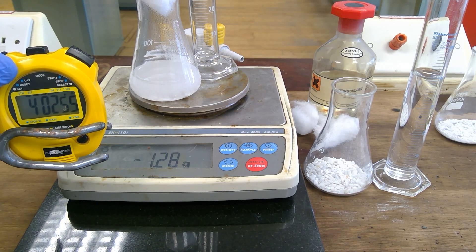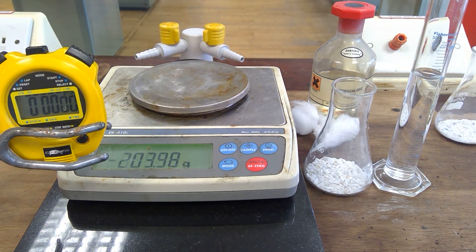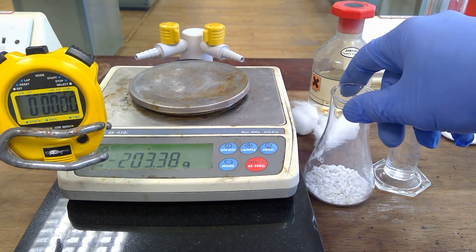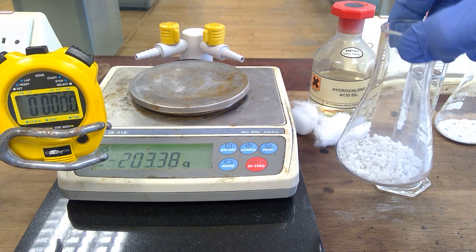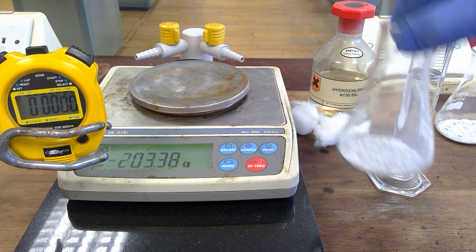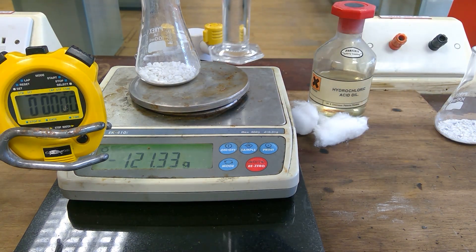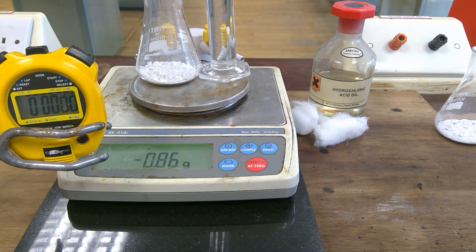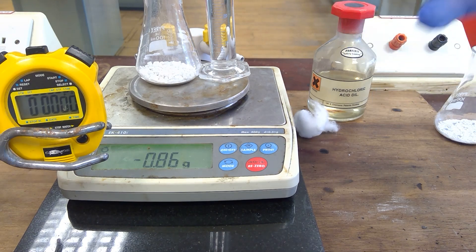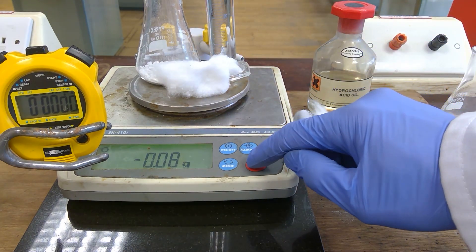We've stopped recording at this point. The next experiment is identical, except this time we're going to use marble chips which are a little smaller, so their surface area is bigger. However, it's still 20 grams, which will be placed on there, and again 40 cm cubed of the 2.0 mole per cubic decimetre hydrochloric acid. The same again — cotton wool is placed on the top, and once more we zero at this point.